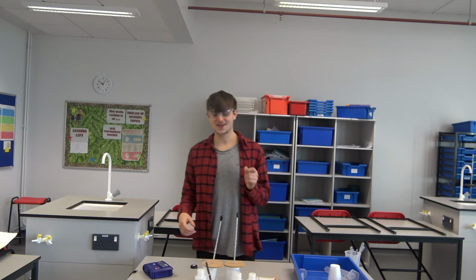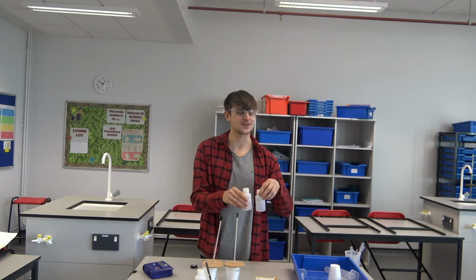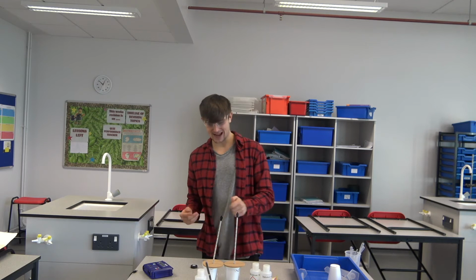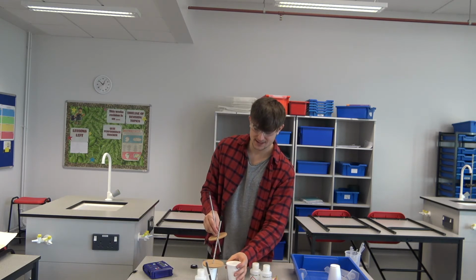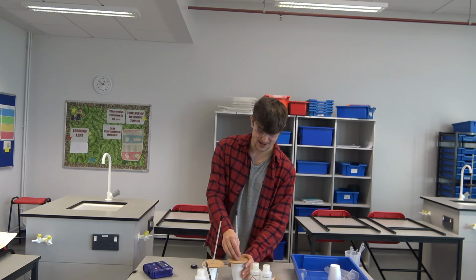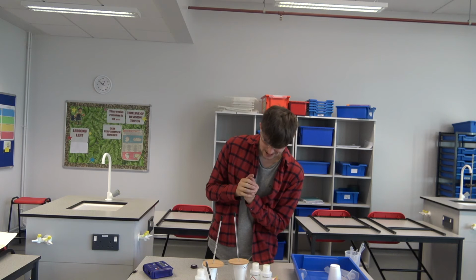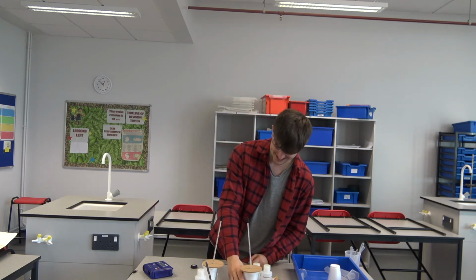So what we observed is over here with the hydrochloric acid and the sodium hydroxide, that reaction was exothermic. The heat increased. In fact, if I take my hand and put it onto the polystyrene cup, I can actually feel some of the heat that is coming out of that. And if I read off the thermometer, the starting temperature was around 20 degrees. My classroom is a bit cold. It's now at 25 degrees C.